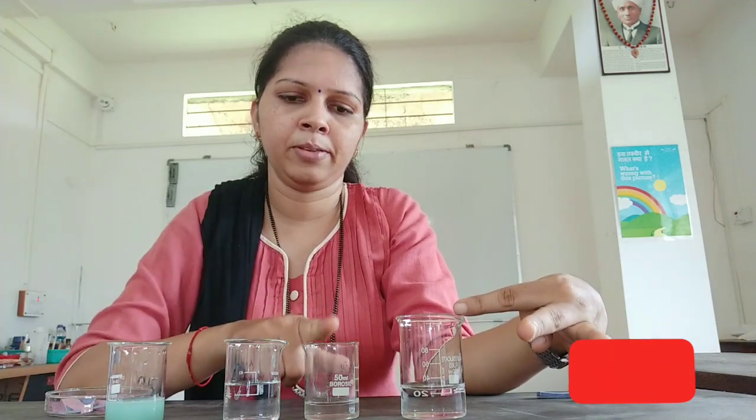Hello everyone, I am here with yet another demo. We cannot identify acids and bases simply by tasting them. This is because certain acids and bases are corrosive and can harm the body. This can be recognized by the effect on certain chemicals or substances called indicators.